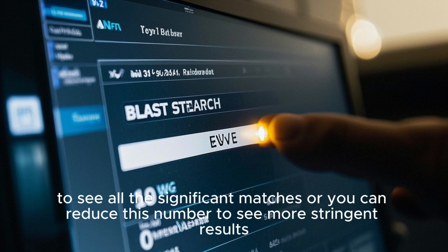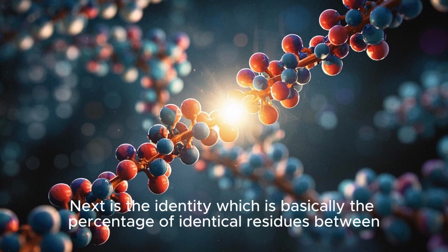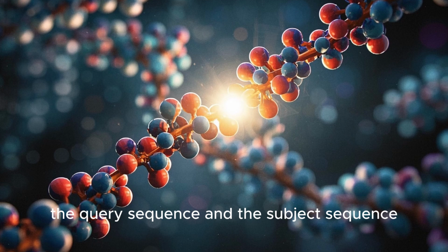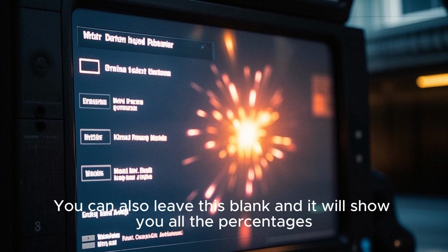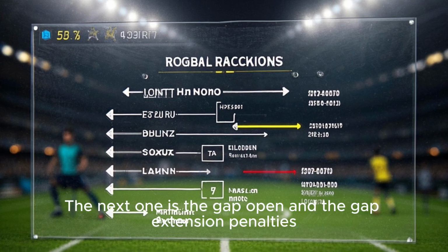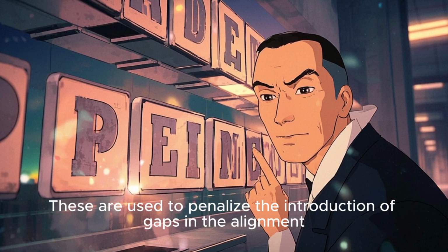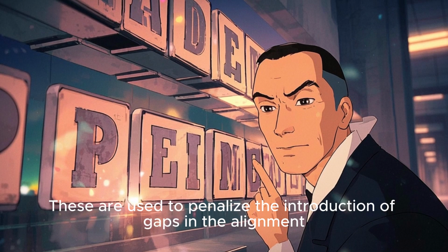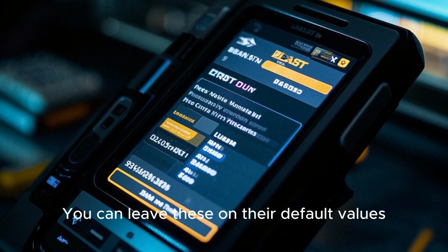Next is the identity, which is basically the percentage of identical residues between the query sequence and the subject sequence. You can also leave this blank, and it will show you all the percentages. The next one is the gap open and the gap extension penalties. These are used to penalize the introduction of gaps in the alignment. You can leave these on their default values.